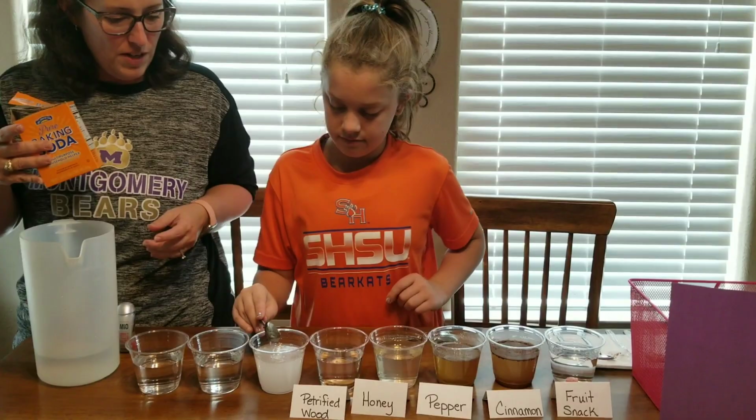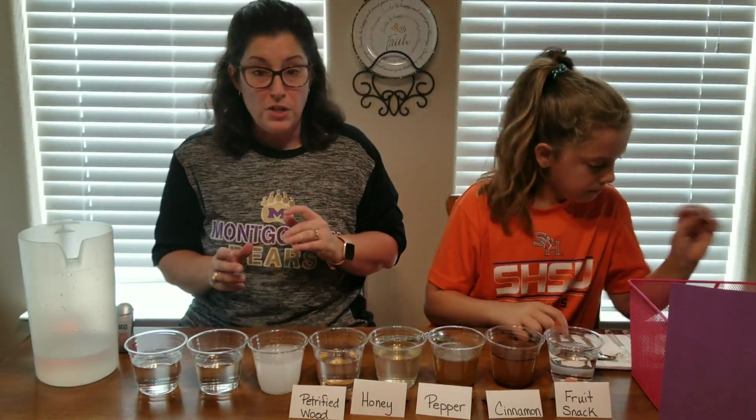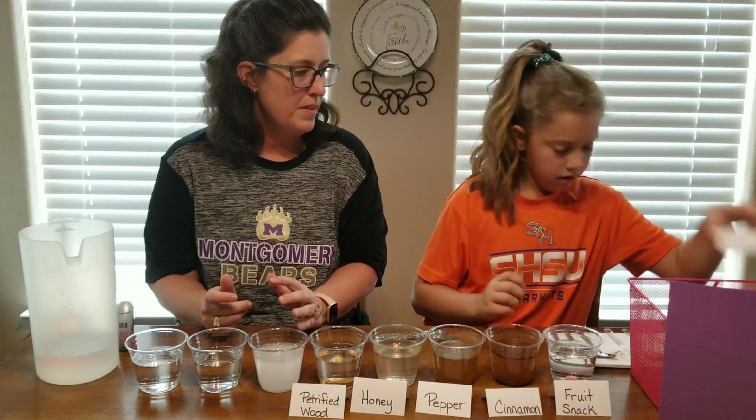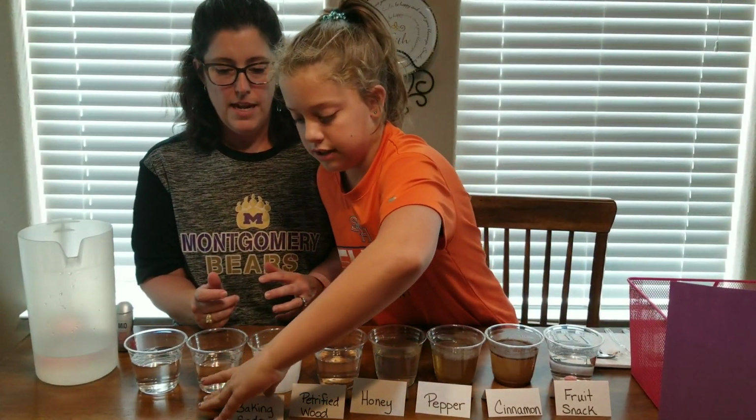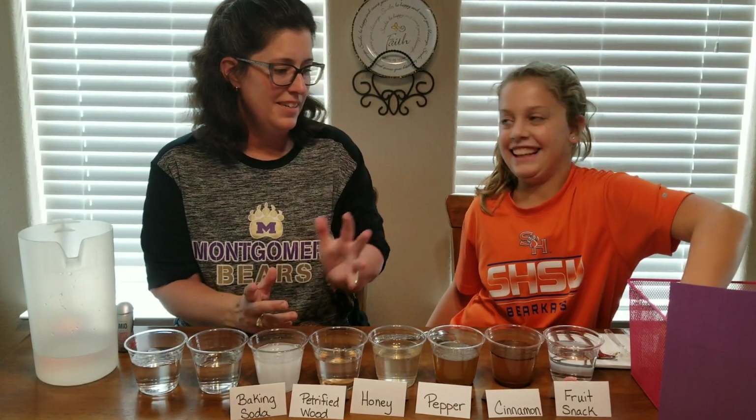All right, can you get a label for it? Yeah. Put this back in the mystery bucket. I gotta move. We've got 2 more, friends. Oh, here. Baking soda, perfect. And second to last mystery substance.